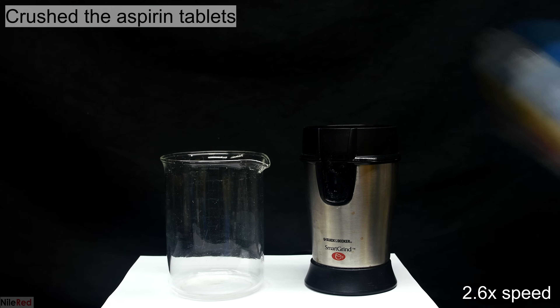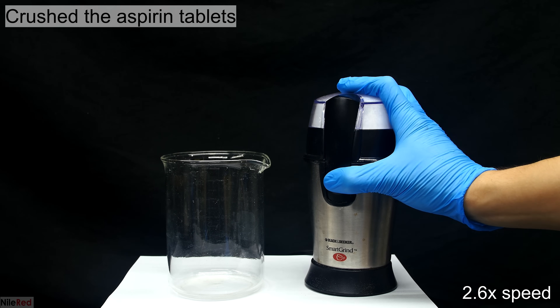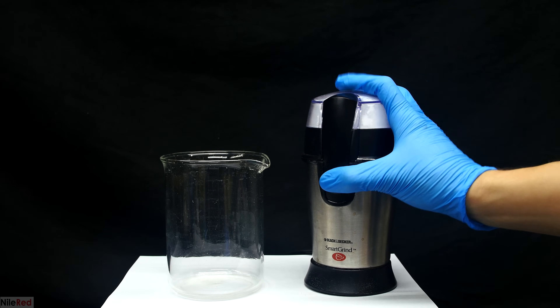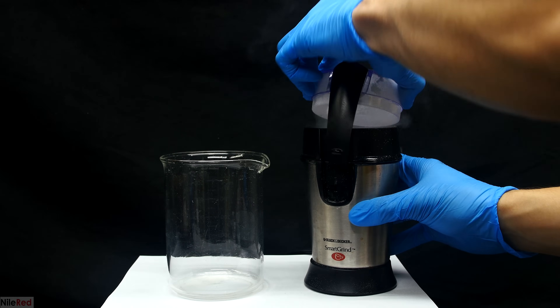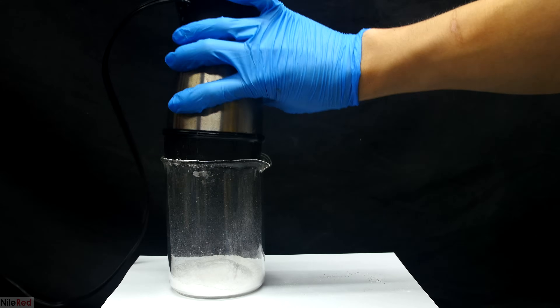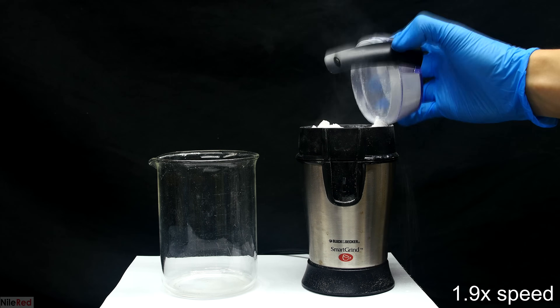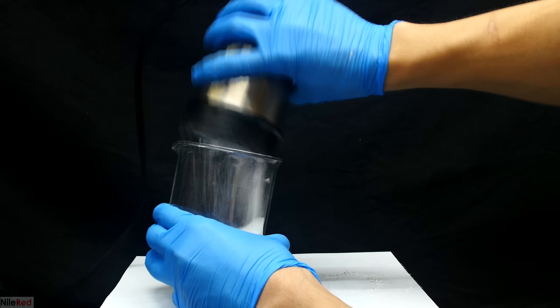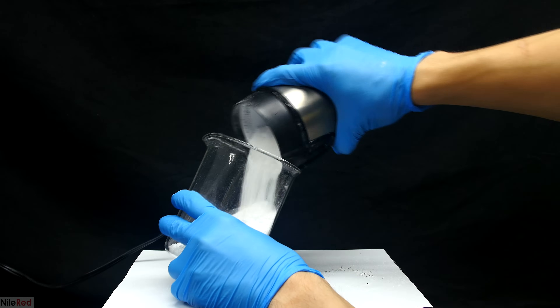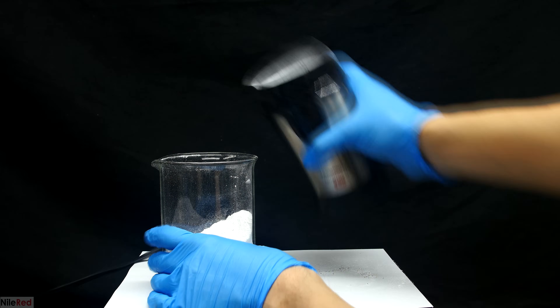To start things off we need to crush the aspirin tablets. The last time I did this I used a mortar and pestle, but it's a lot easier to use a coffee grinder. I keep the grinder going for a few seconds to make sure everything has been fully powderized. I remove the lid and when I go to pour into the beaker I made a mistake — let's just pretend that didn't happen. This time I'm a little more careful and don't spill anything. I then crush up the rest of the pills and combine the powder in the beaker, and I also dropped in a stir bar.